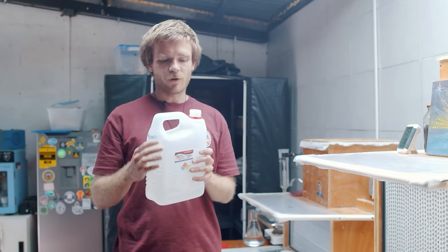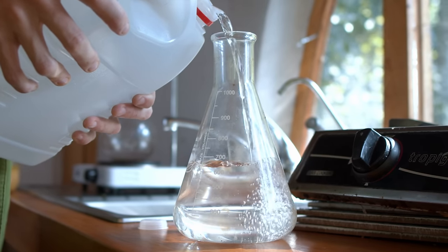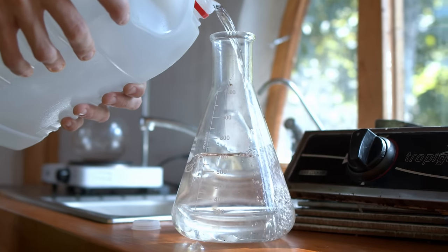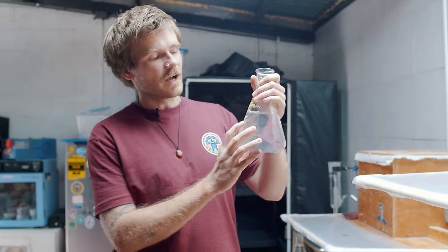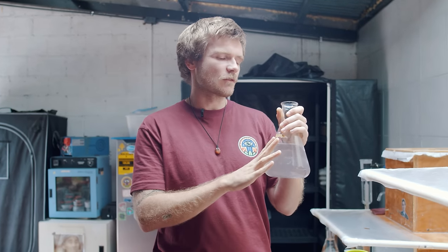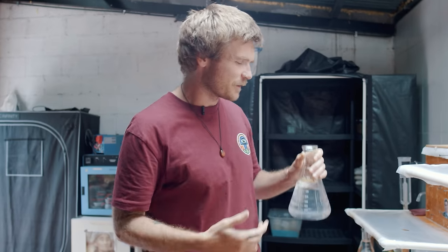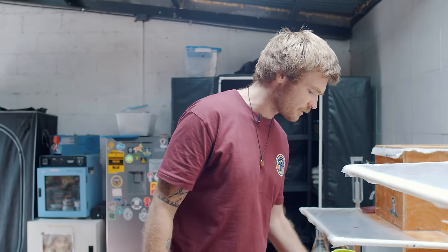First up, we want to use our ethanol — preferably 95% organic alcohol. For my extractions I like to use less than 800 milliliters, because if I did a 50/50 split — one liter of alcohol, one liter of water — my tinctures taste too strong with alcohol. I prefer to aim for around 30% alcohol, so I put in about 750–777 milliliters of alcohol.